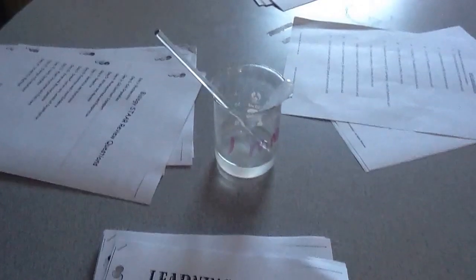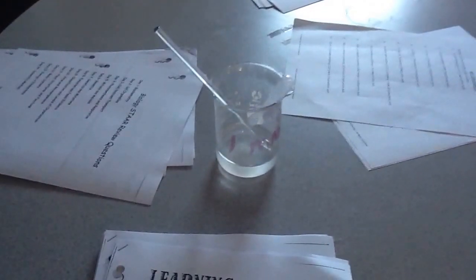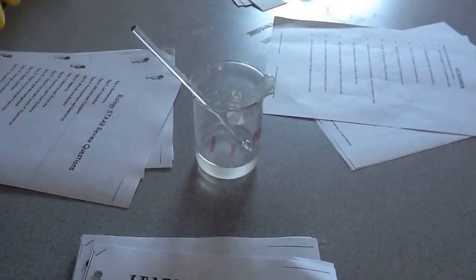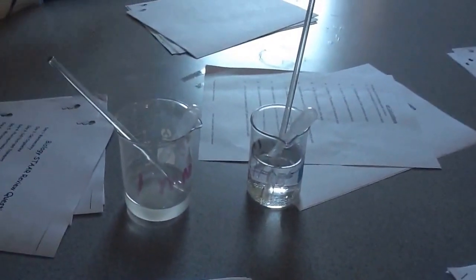NaOH, that's our base. You notice the base is clear. This next one right here is your acid. So acid's going to be on the right, base's going to be on the left. Got it?